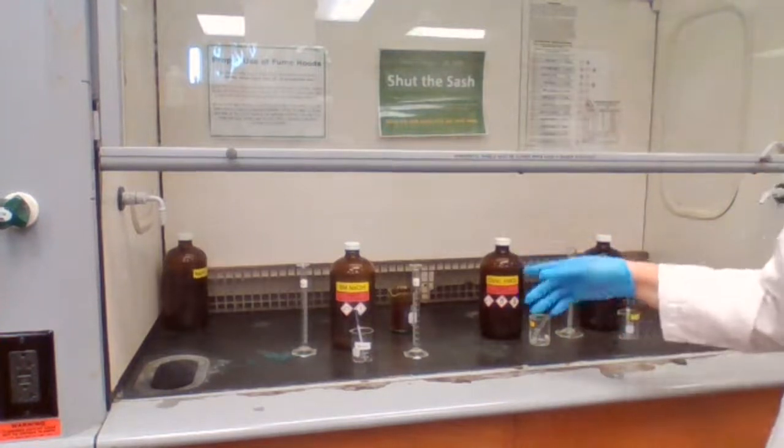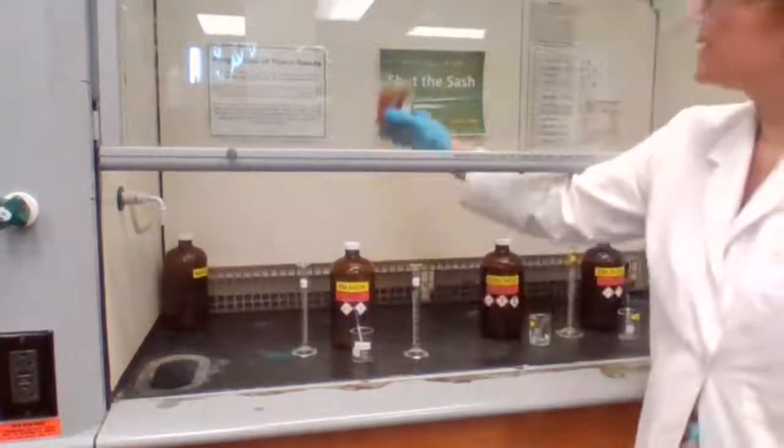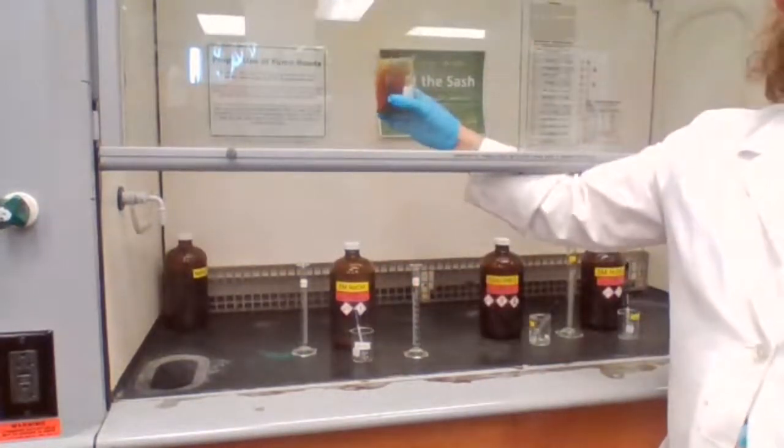That fume, I don't know if you see or not, it's up here. You see it now?